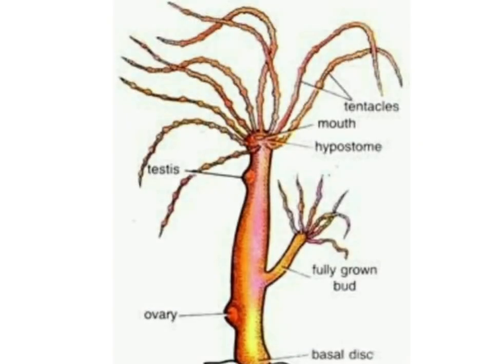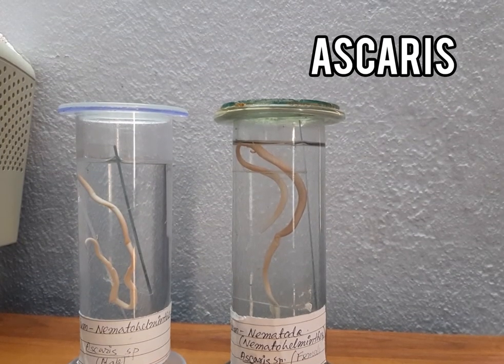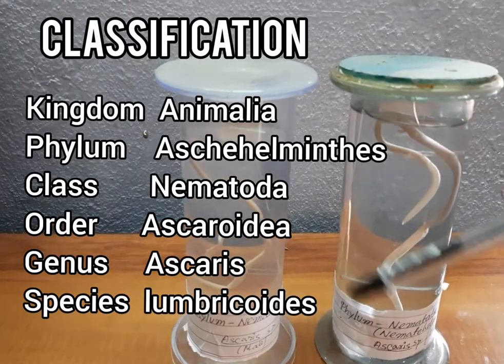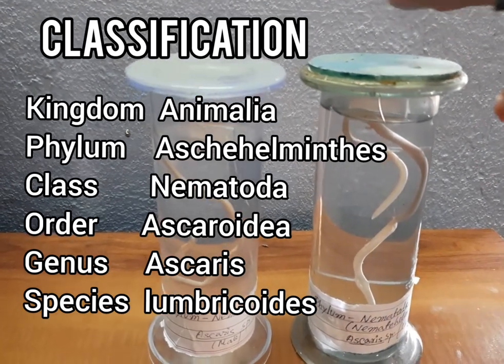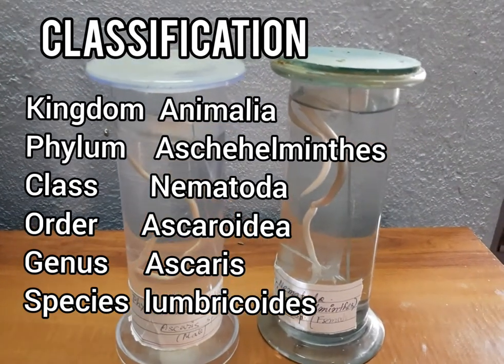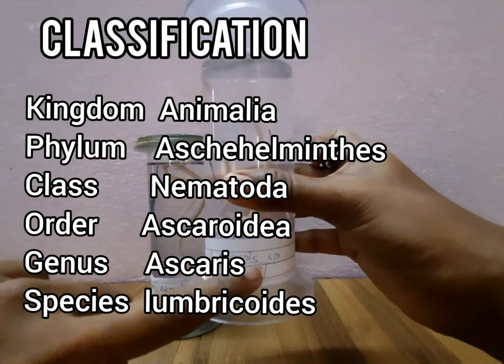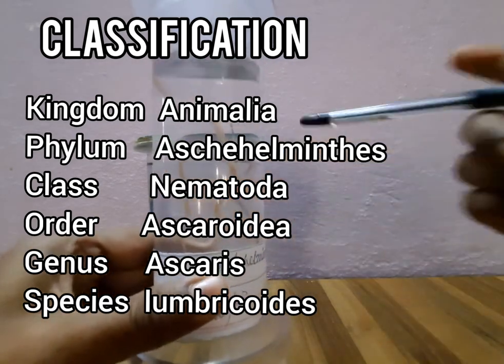The next invertebrate in this video is Ascaris. The hierarchical classification of this organism: it belongs to Kingdom Animalia, Phylum Nemathelminths or Aschelminthes, Class Nematoda, Order Ascaridea, Genus Ascaris, and Species lumbricoides.